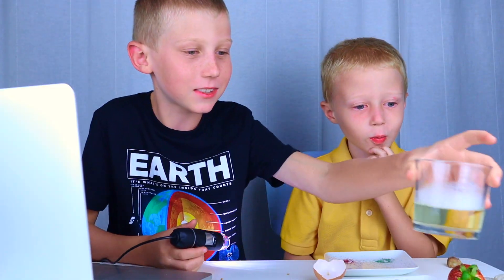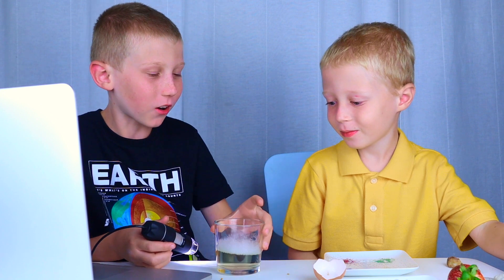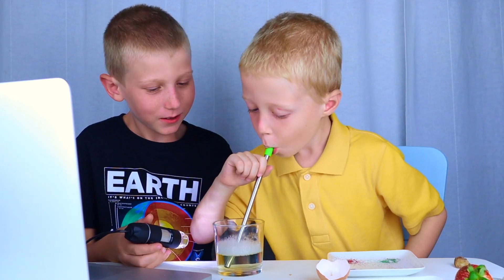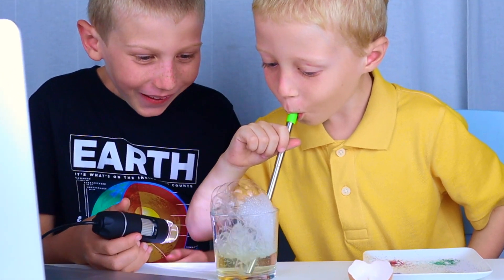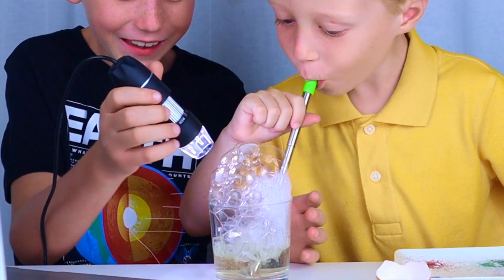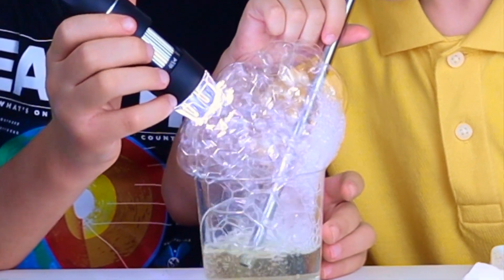Let's see some dish soap and water. Beautiful!